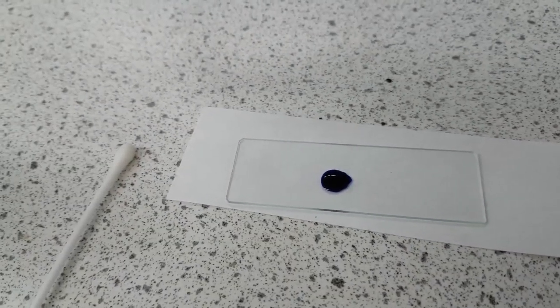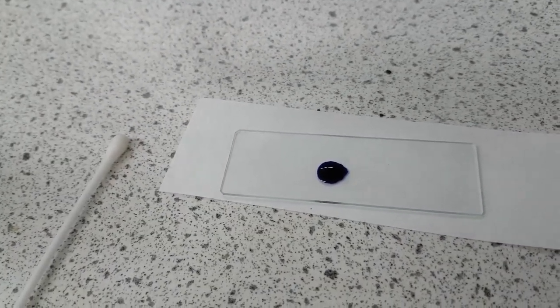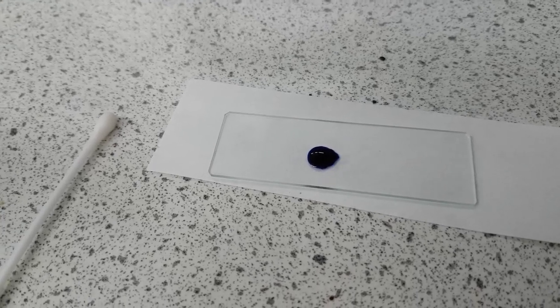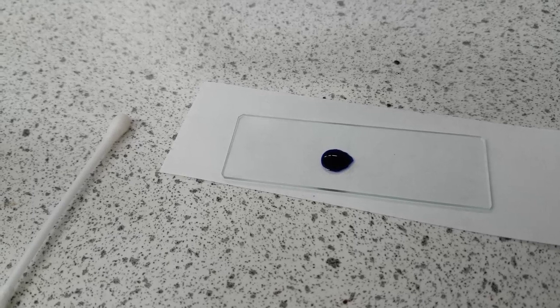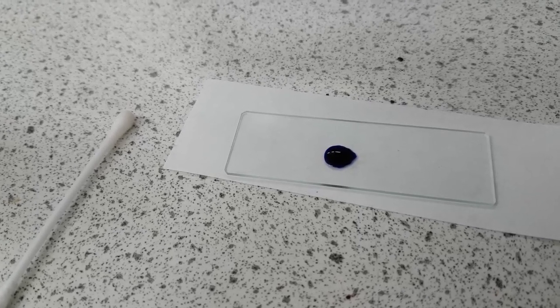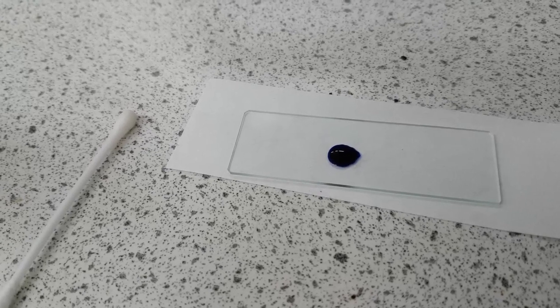And that's done. Once you've got your methylene blue on, remember the reason why we do that is because it's a stain and so we can see the different parts of the cells easily. Now one of the things is like I said it is a stain so you want to avoid getting it on yourself because believe it or not it will stain.